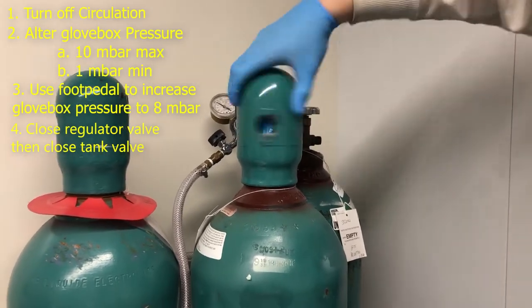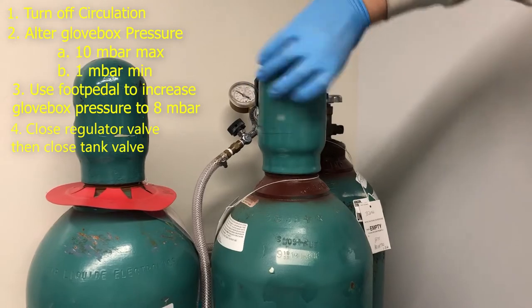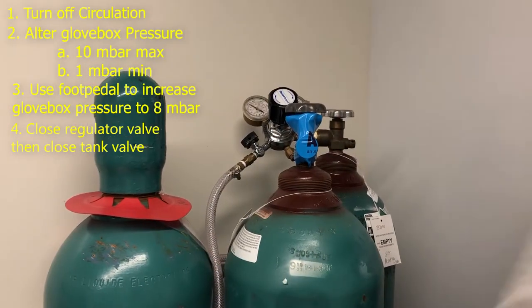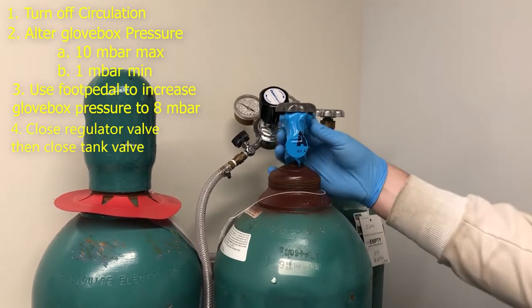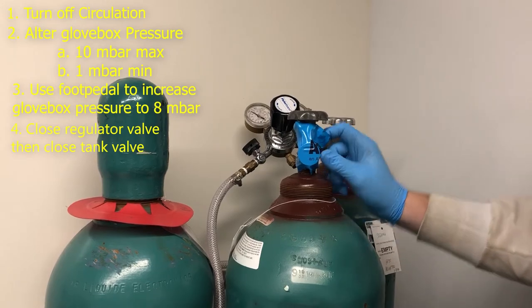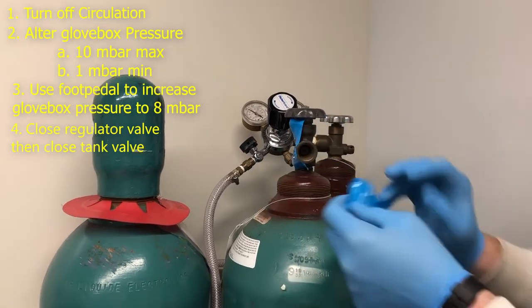Lucky for us it's already here. Okay. And we're going to take this off with scissors. Somebody used to use a razor. Or my hand.